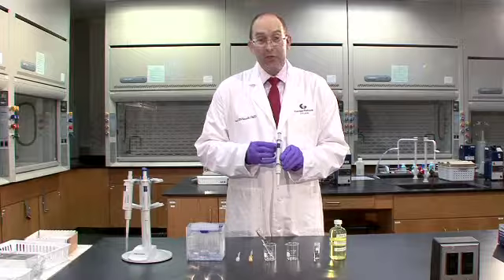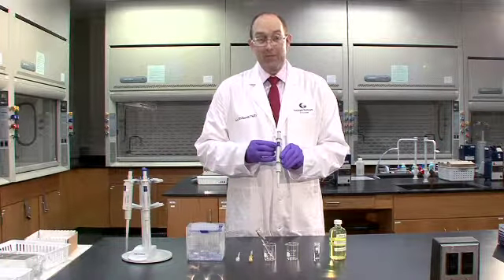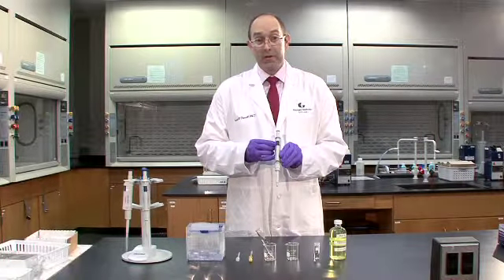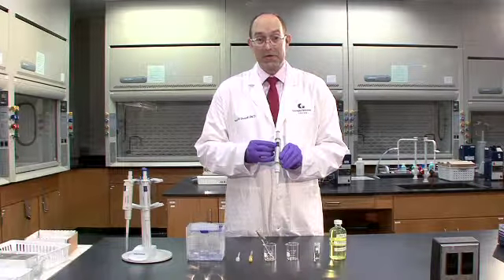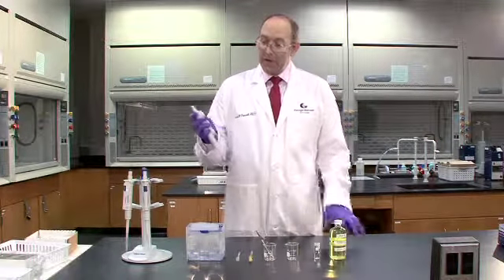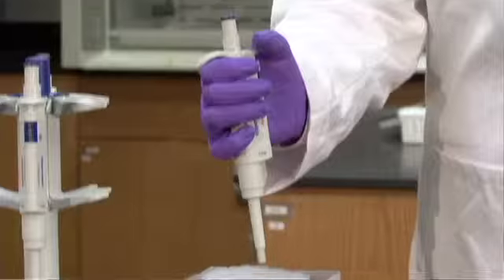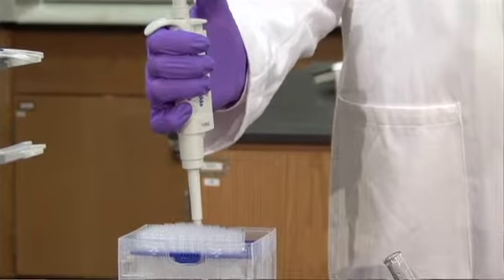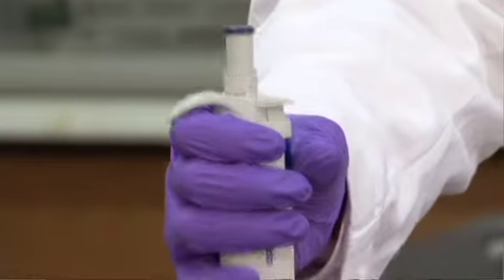The calibration can be changed anywhere between 1,000 microliters and 100 microliters, still allowing us to draw a very precise quantity of material. The ADP is used in conjunction with a disposable pipette tip. You'll see throughout the lab that we've got boxes with the pipette tips deployed, ready for your use.